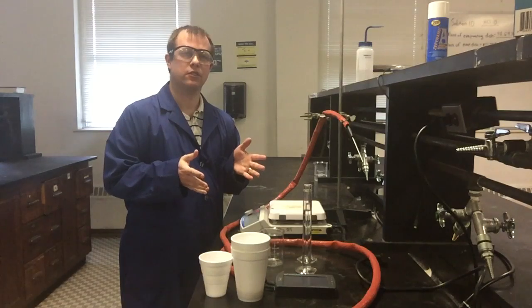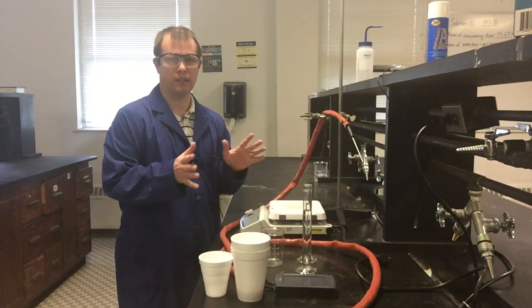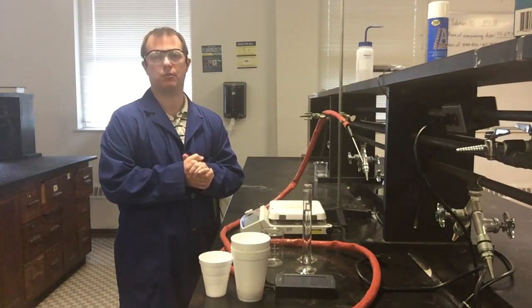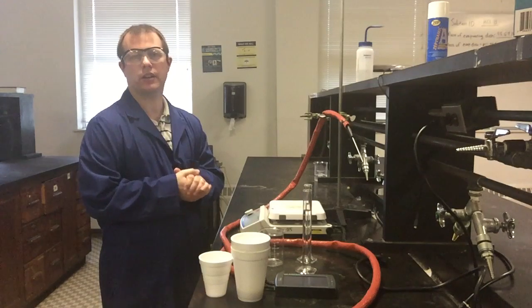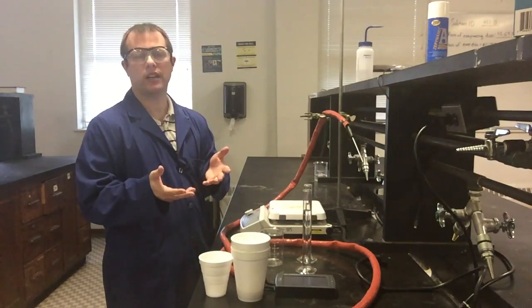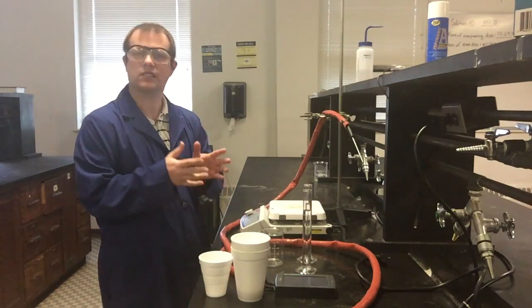This week what we're going to be taking a look at is enthalpy of neutralization. And so you'll see a setup here that actually looks probably a little bit similar to some things we were working with just a couple weeks ago, or maybe just a week ago, depending on how fast your program's going. And what we're going to be trying to do is really look at the energy that's released by an acid-base reaction. That's kind of our goal.